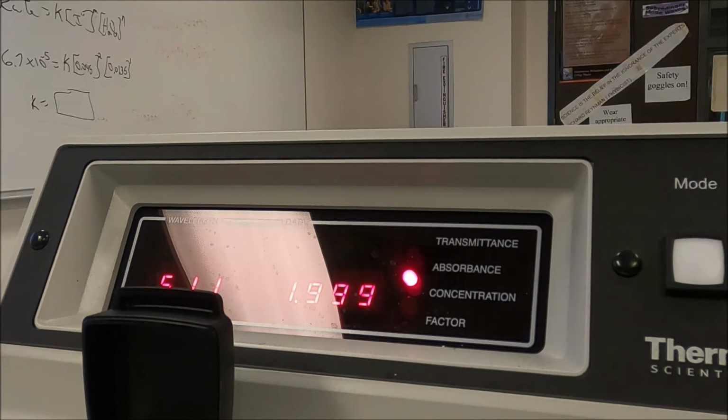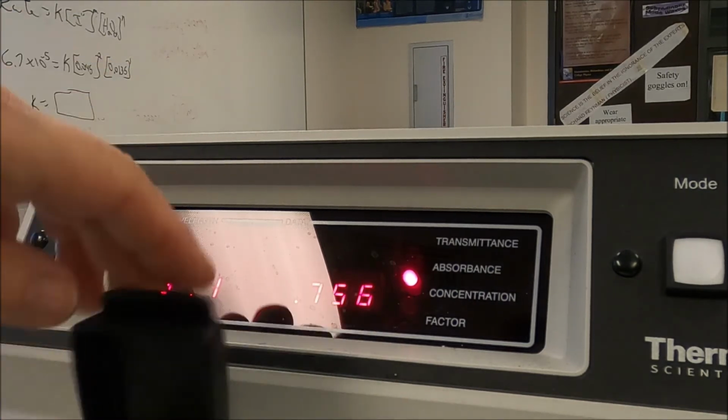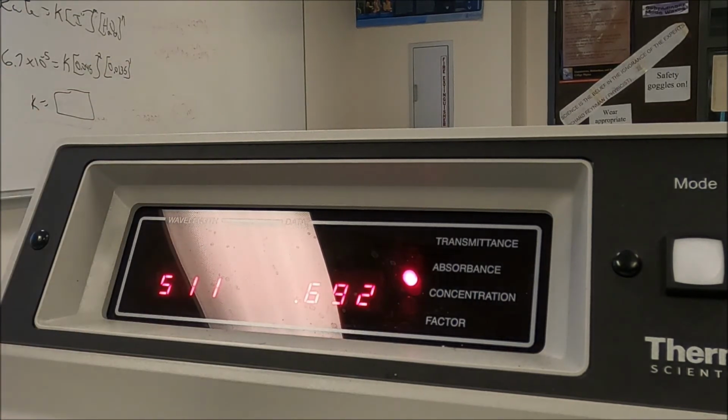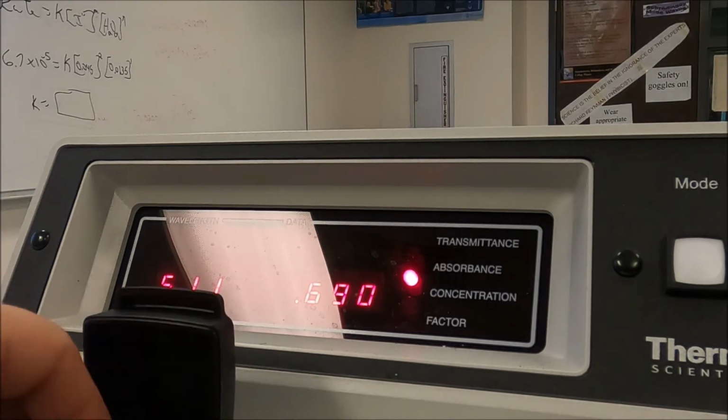Unknown number 1. Pop it in. And I get 0.694. No, 0.692 now that it's settled. Okay.